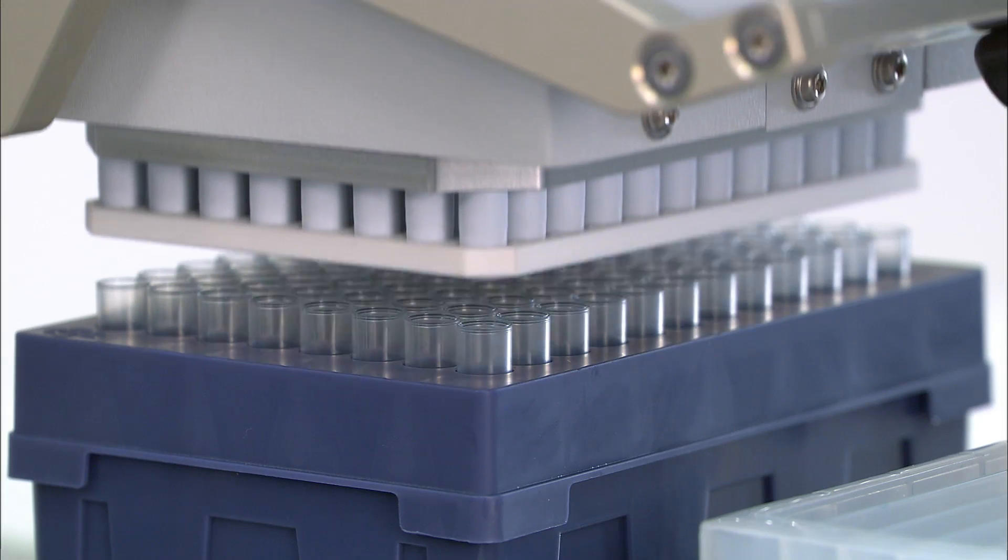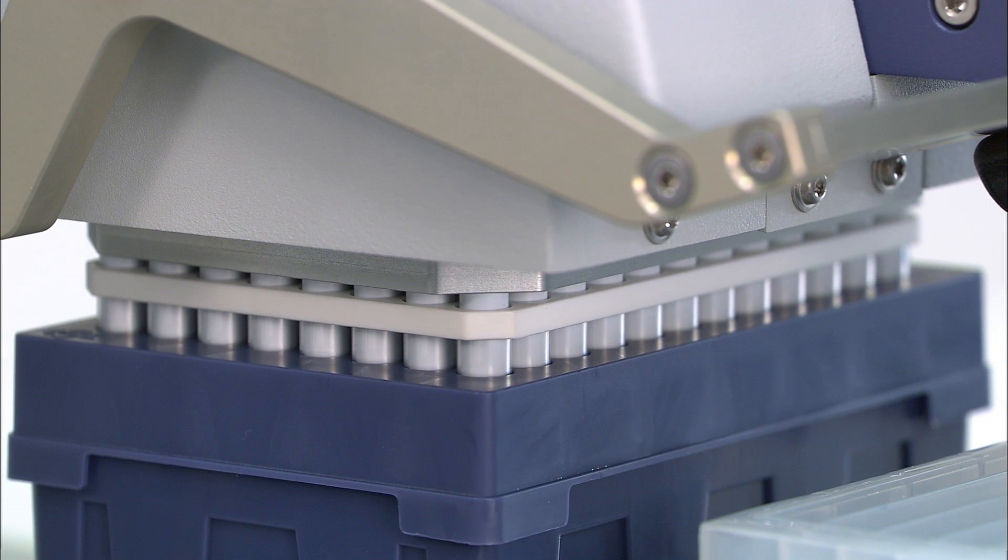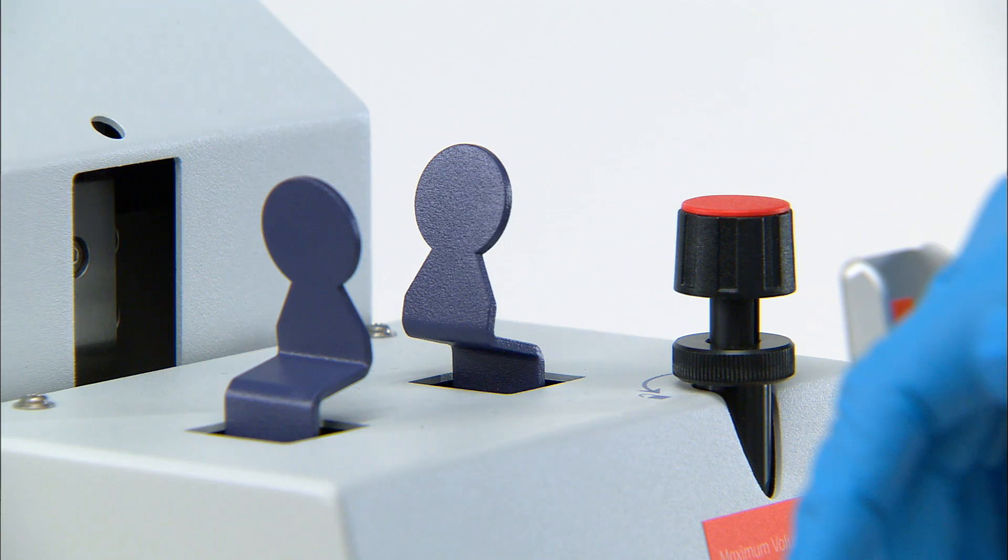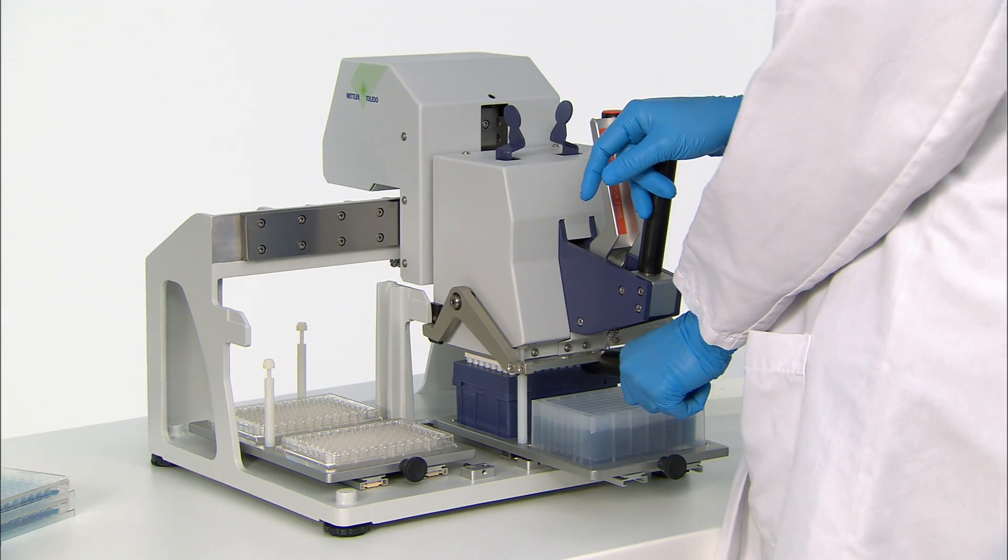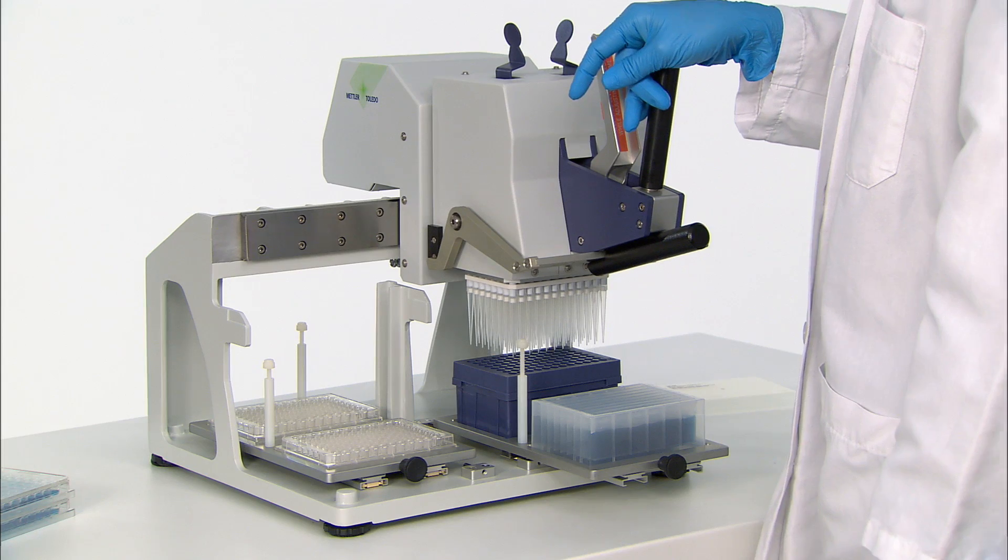Push down on the pipetting grip until all 96 nozzles fit into the tips and the tip release levers spring open. Then push down on the tip mounting lever until the tips are firmly secured in place.